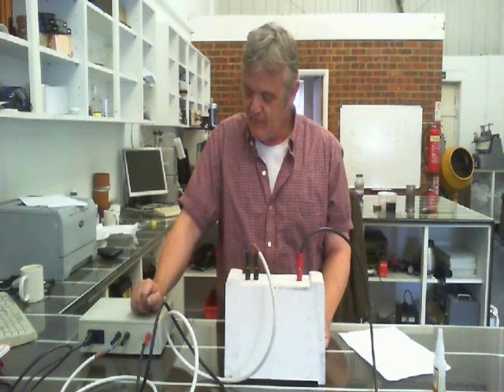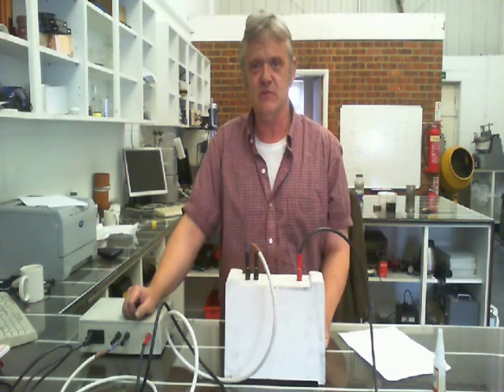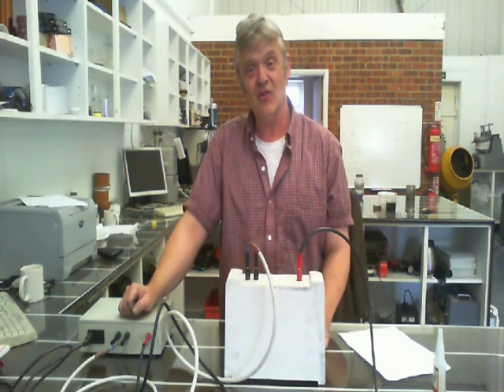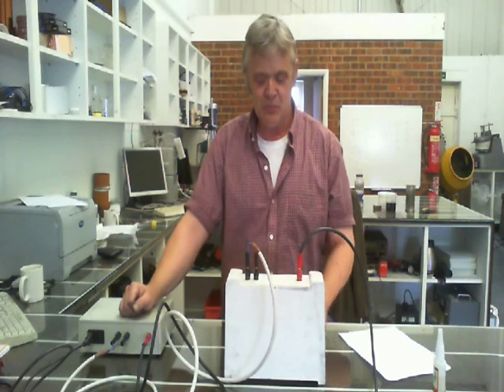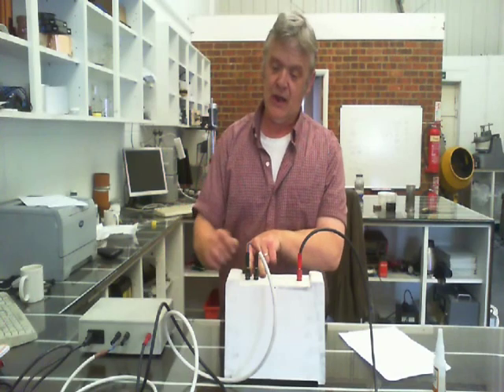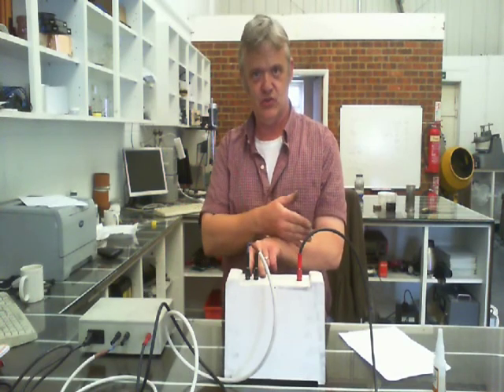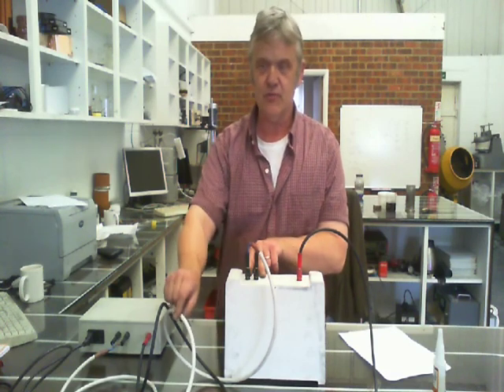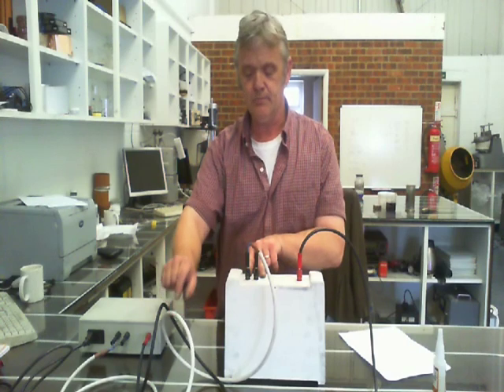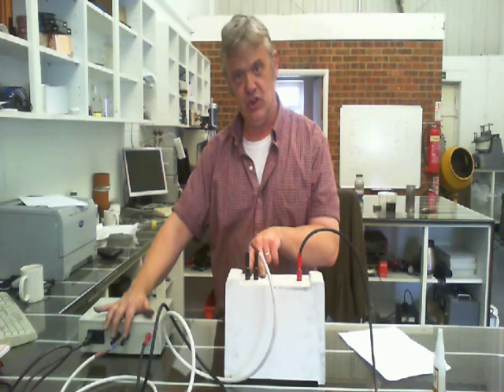If it was a sort of proper high voltage thing, they'd be sunk in a bit, but because I've made it with bits and pieces available to me, then it sticks out a little bit, and hey, I'll remember that, and if I don't, I'll be sorry I didn't, but I won't forget afterwards. And I put two black banana plugs here to tell me about the lamp, and it doesn't matter which way around they go for the lamp, so they're both black just to differentiate them from the high voltage. And then I got a bit of this, which is some stranded 1.5mm wire put into the black banana plugs and then feeding into my lamp connections here.